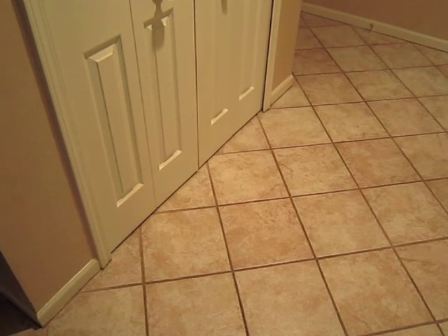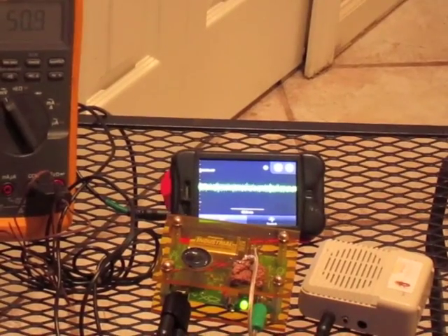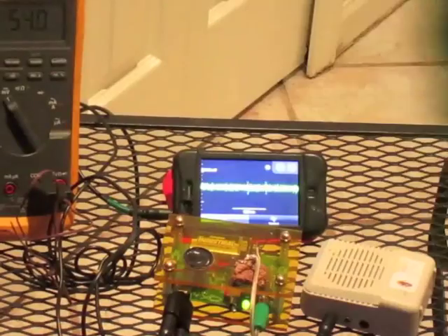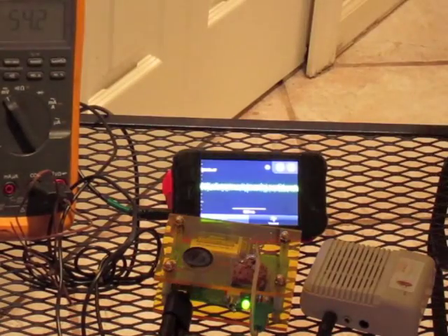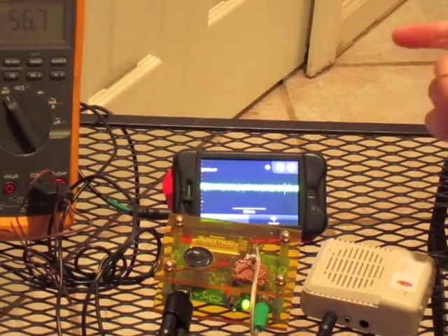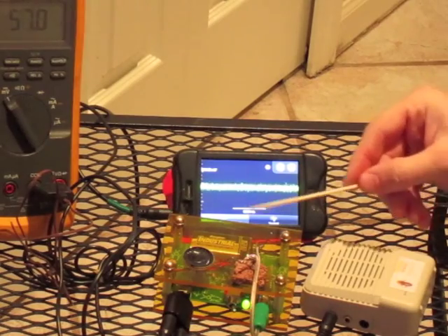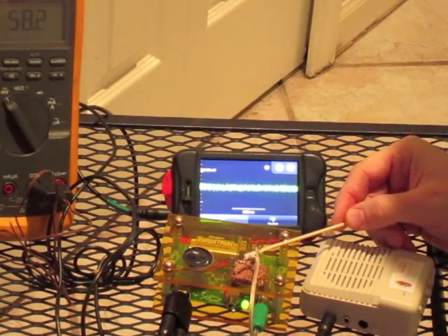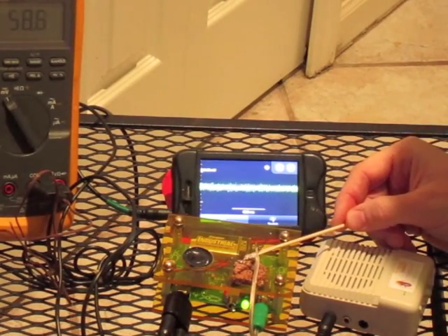Now I am returning the very cold cockroach leg back into the house to warm up. And though it almost instantaneously warms back up to room temperature, there's no neural activity present. Why is this? Perhaps the leg is dead, but we are patient scientists and we will wait.